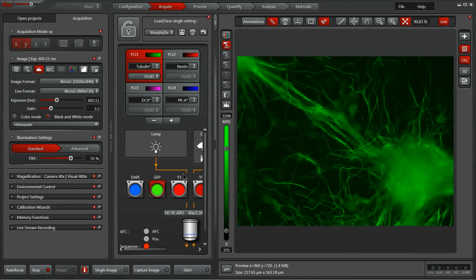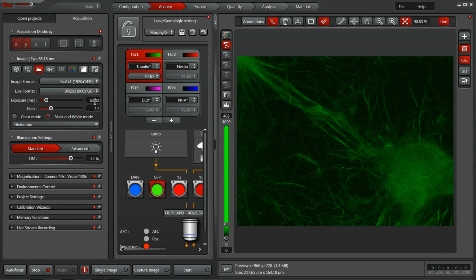And that might be an easier way for you to quickly establish an exposure time if your exposure times can change frequently. Equally, if you quickly move back into a preview setting where you're looking for the next area, you might find it very beneficial to drop down to a lower exposure time, say 65 milliseconds for a nice fast refresh, and the auto contrast will keep the scale displayed down here in the bottom so you can still see what you're looking at but reduce the total duration of time you have to stare.